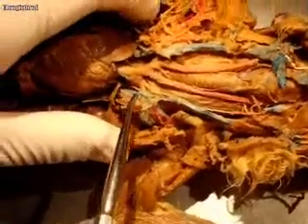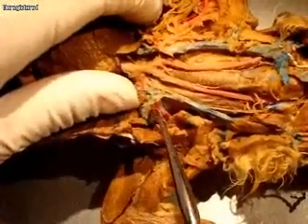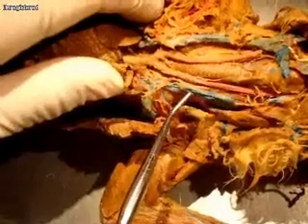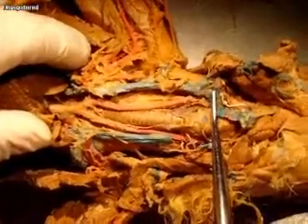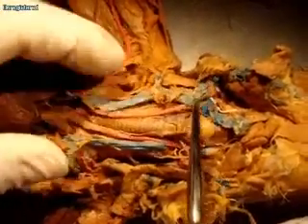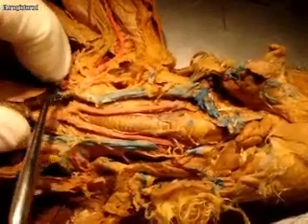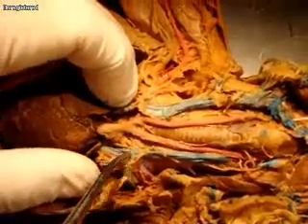On this side we can see a little better. Here you have, again, the left cranial vena cava. And then that's going to split and form a subclavian vein, and then an external jugular vein that's going to come up here. And then these are connected by a transverse jugular — this is a transverse jugular. And then this is going to split again. There should be an internal jugular that's really small. This little knob right here might be the internal jugular, because it goes this way.